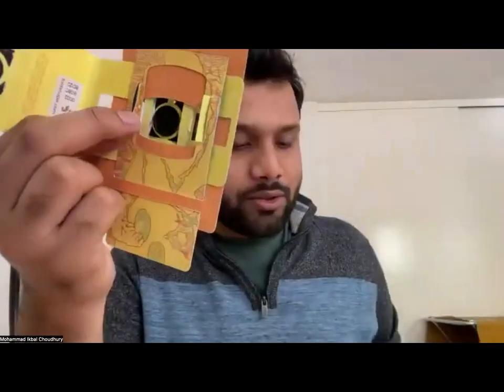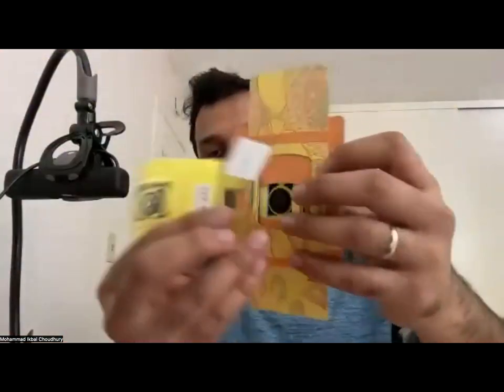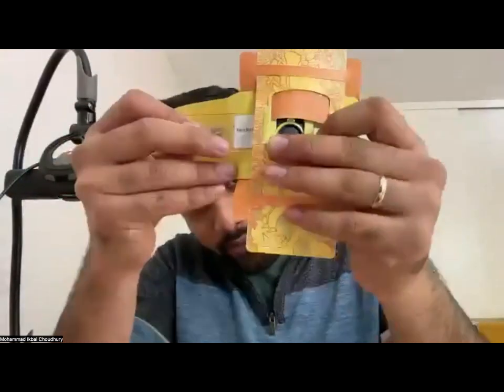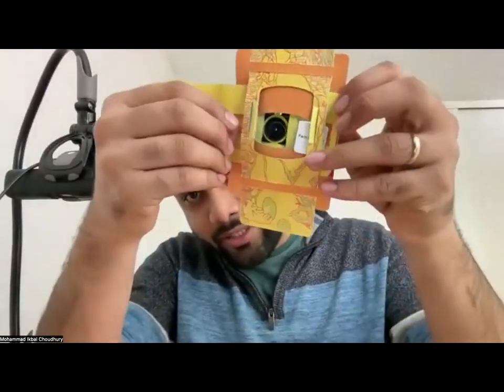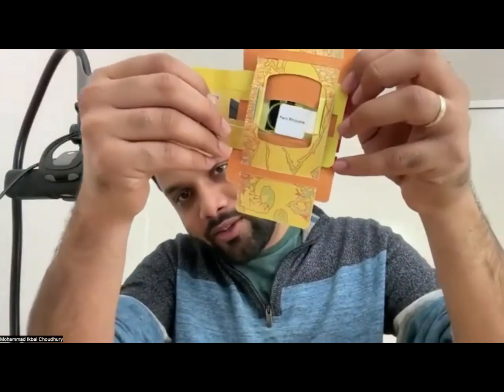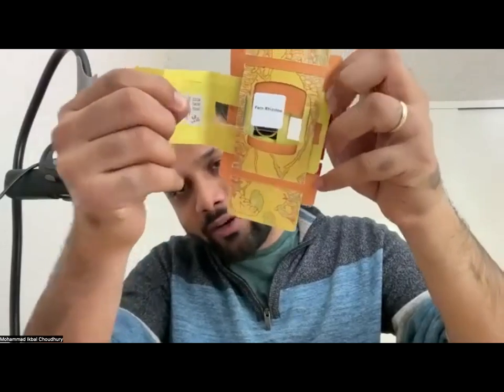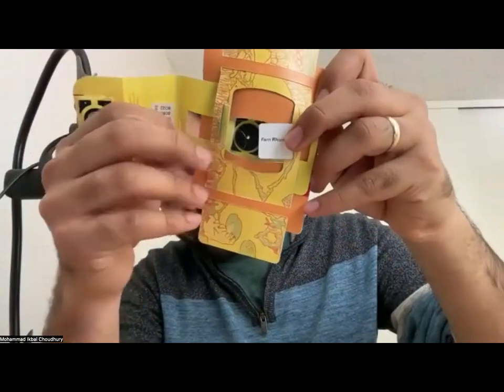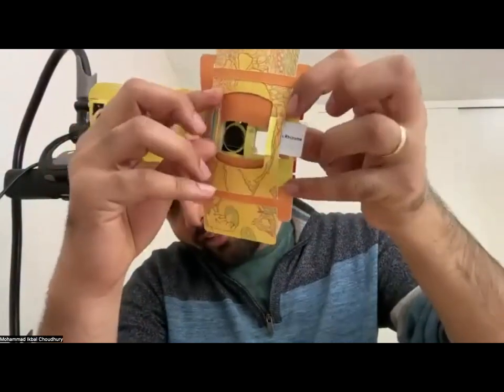Usually we put the slide in the wrong place, and I'll tell you why. Let me show you. If you push the slide there, it seems like the slide is going in, but you see the slide doesn't stay anywhere. So you need to make sure that the slide is stuck to this piece of paper here. The only way to do that is to flip this flap, this tiny one, and insert it in between. It doesn't seem like there is any space, but you can, you see?